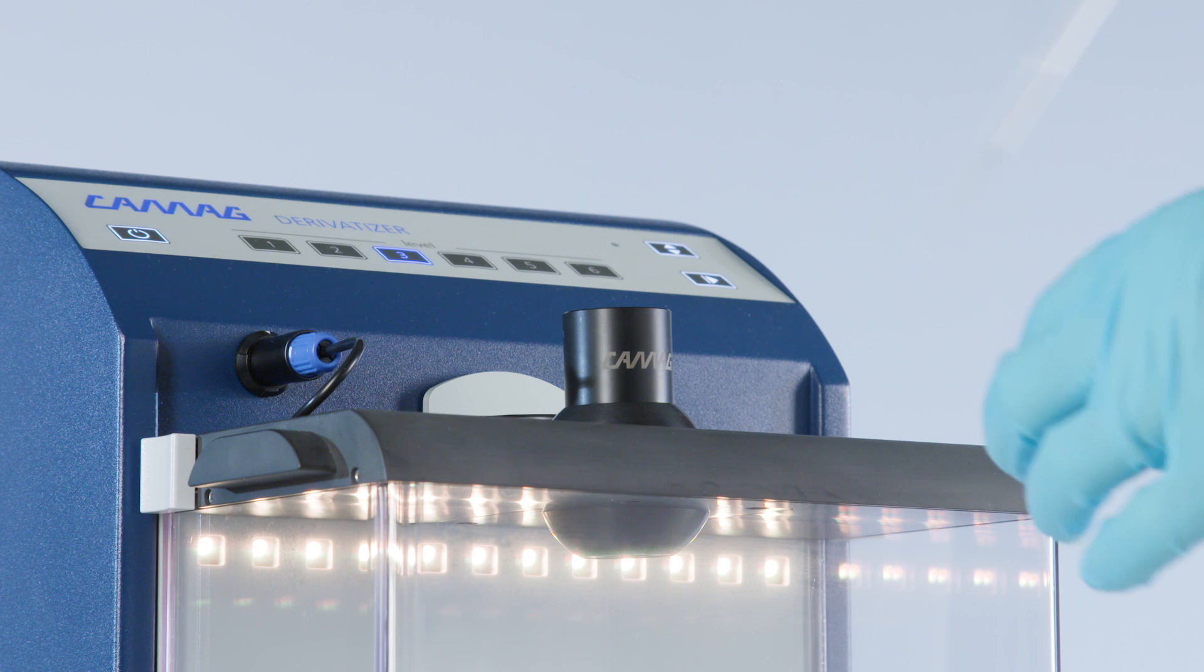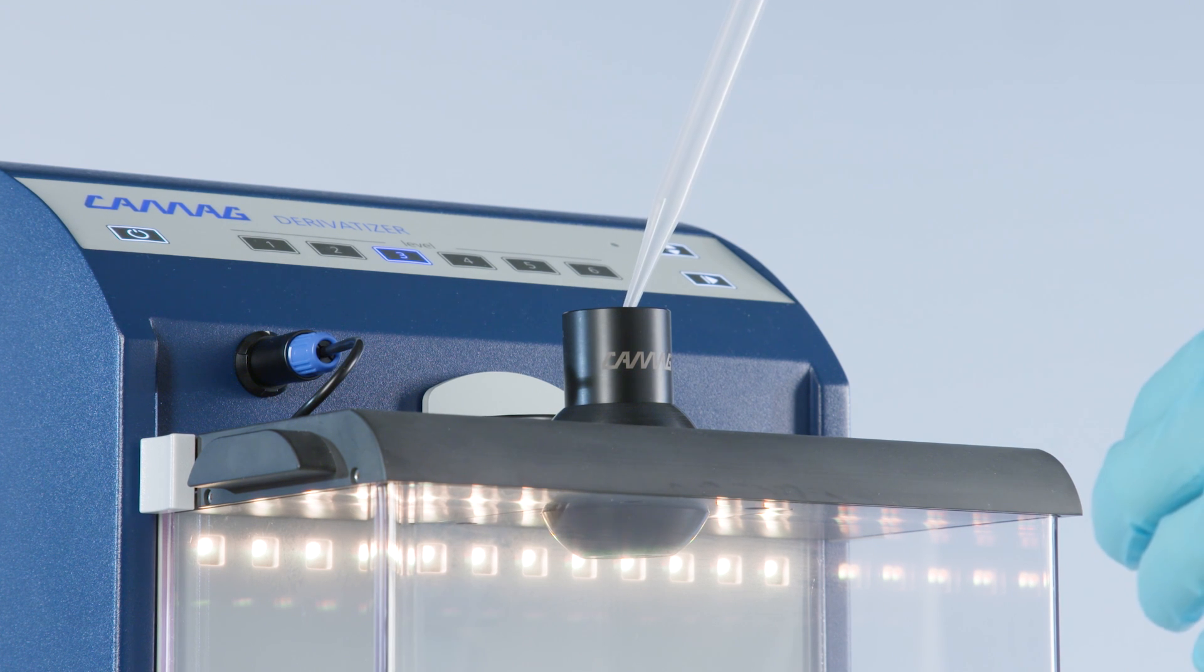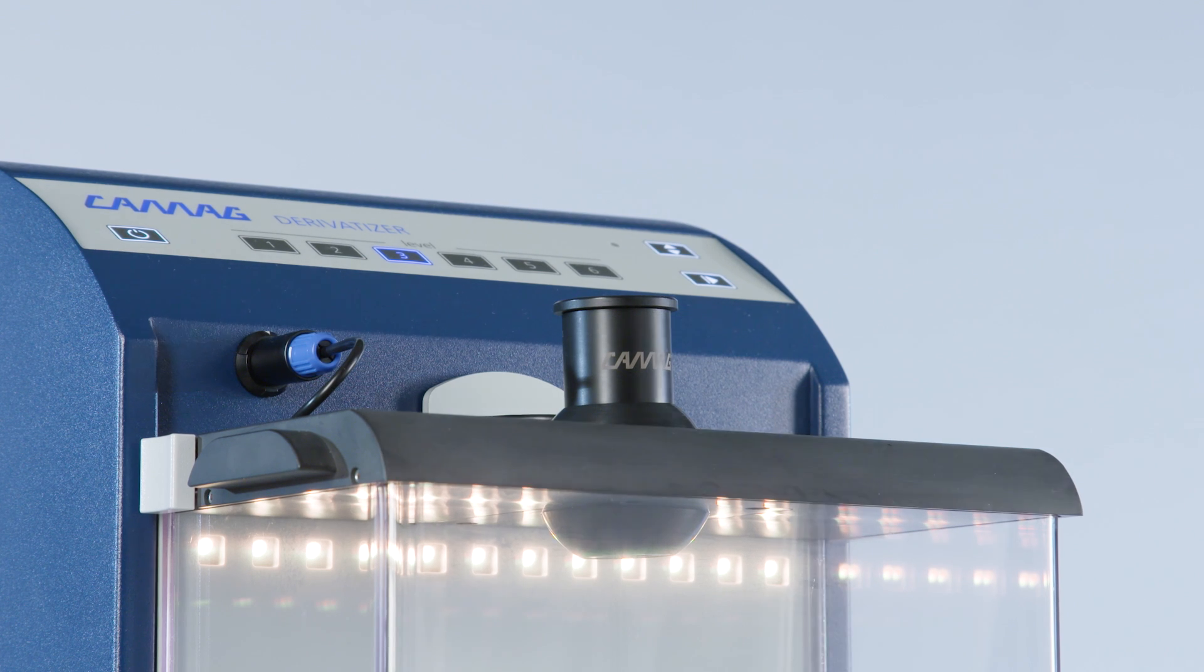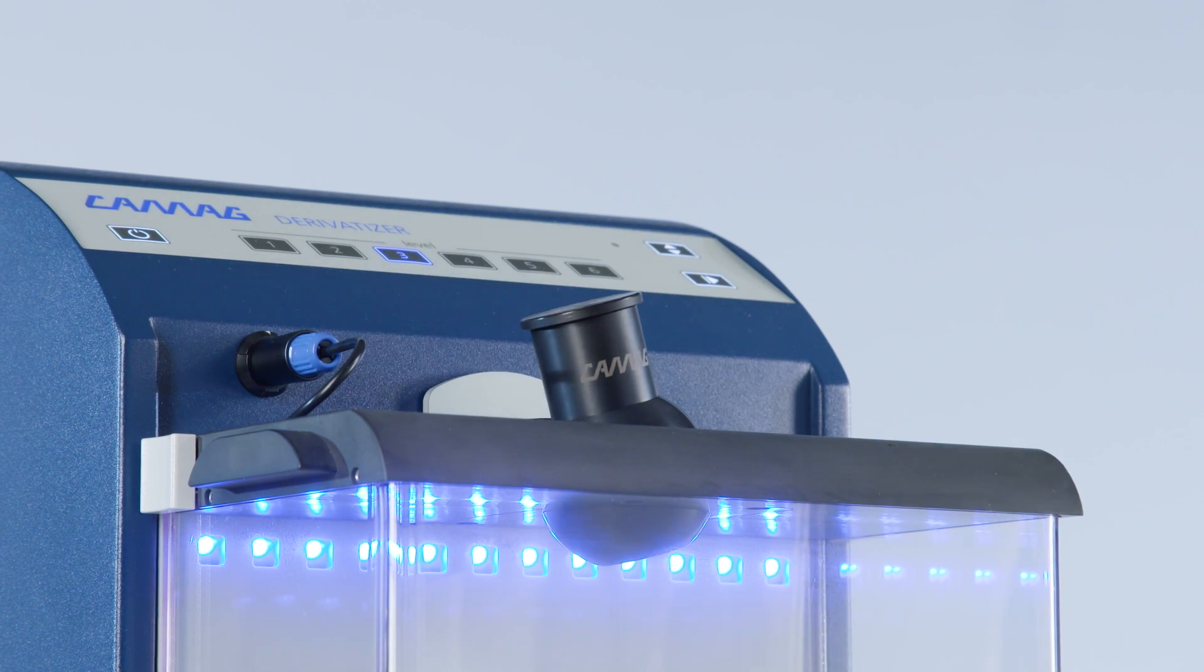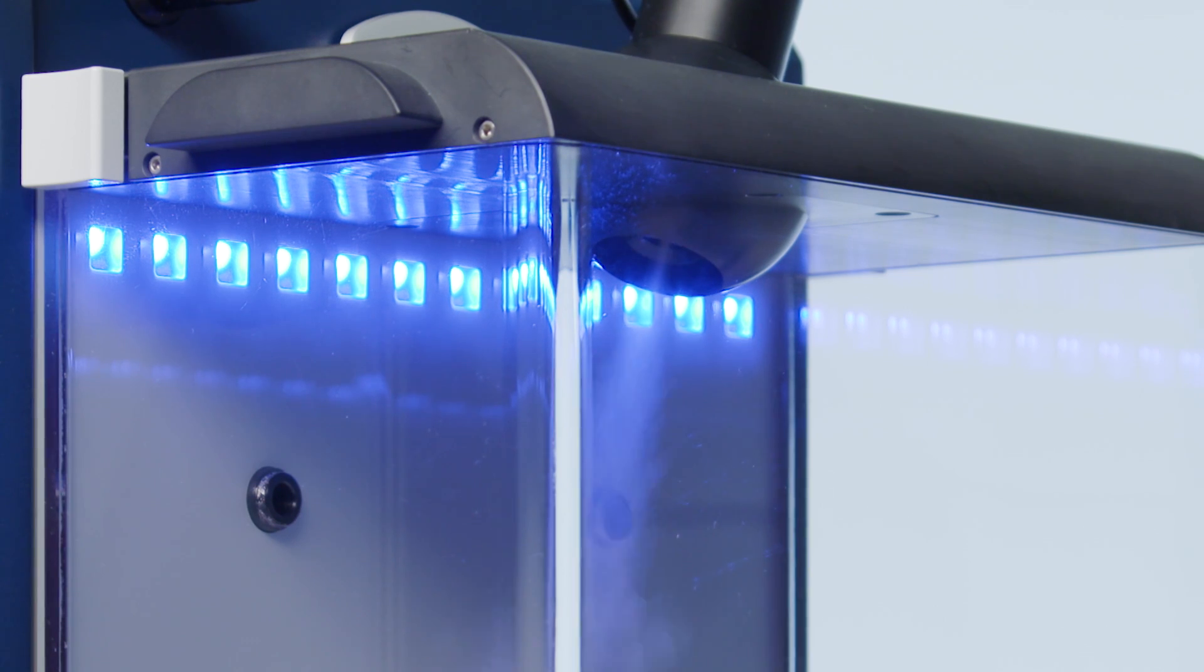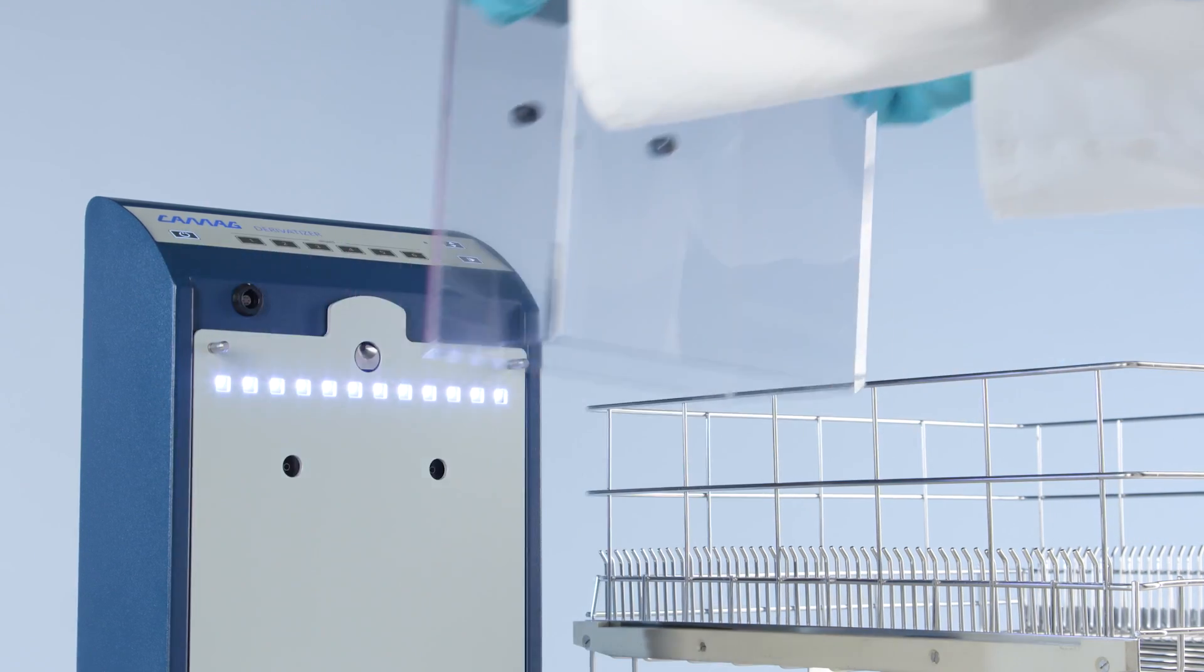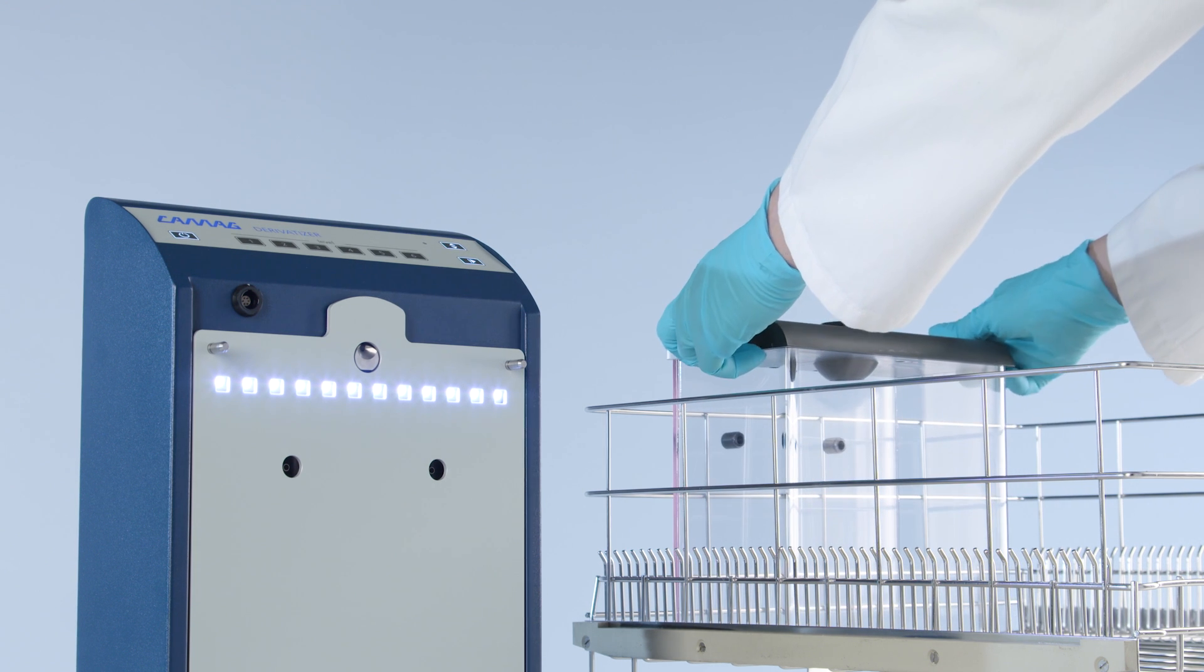After completion of the spraying process, an easy cleaning procedure can be carried out. Simply rinse the nozzle with the appropriate cleaning solvent and conveniently clean the hood with paper towels under tap water or in the dishwasher.